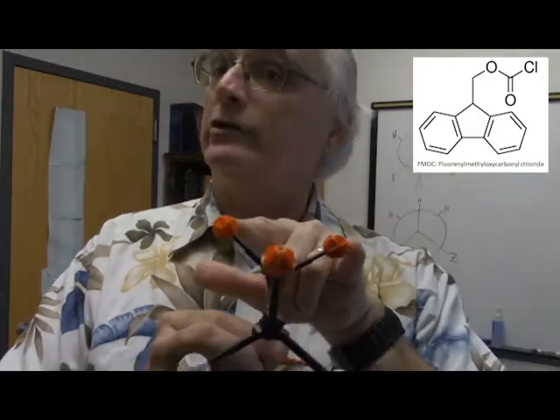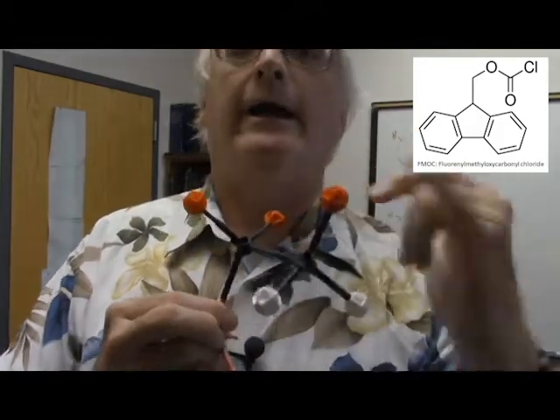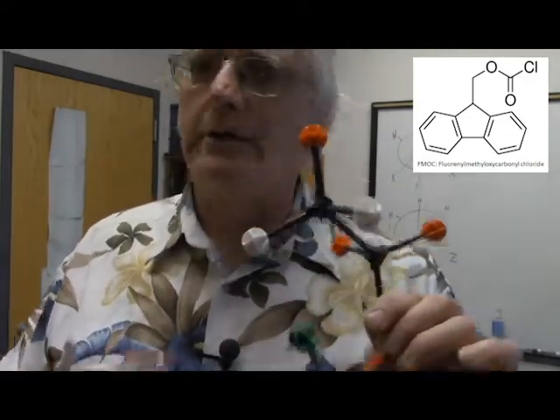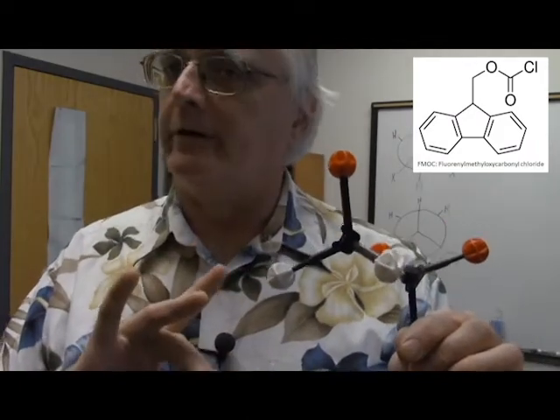There's the CH2, 2 equivalent protons, causing this guy to be a triplet. Everything is just perfect with this molecule. Like I say, textbook molecule. Terrible name. Textbook proton NMR spectra.